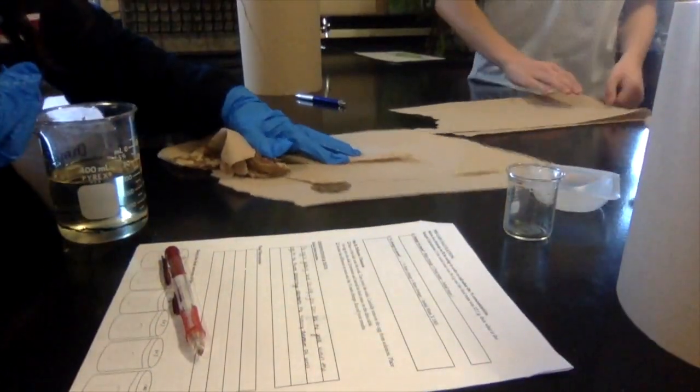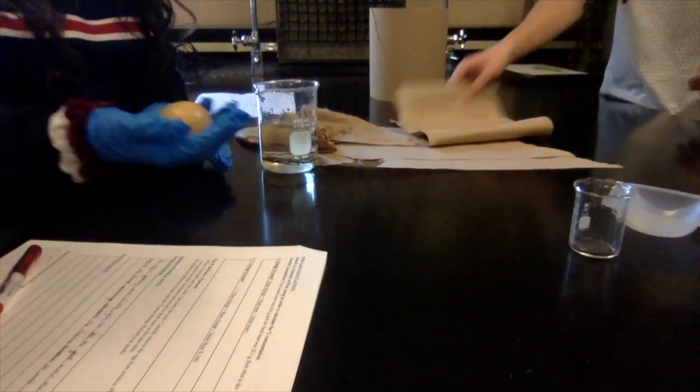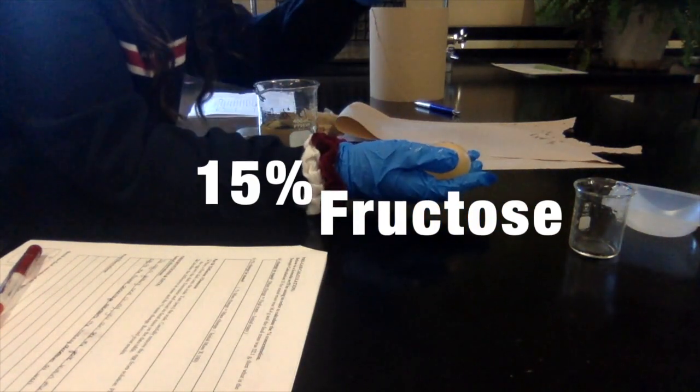I would like for you to, you don't have to be in it, but you need to show the egg and talk about the egg. What you notice about the egg. Okay. So talk about the egg in comparison to the other egg that you saw. You chose that. No, but now I'm touching it, so you talk about it.